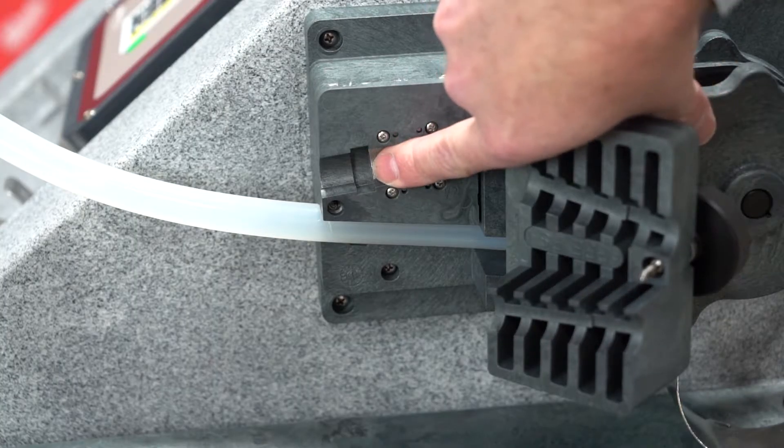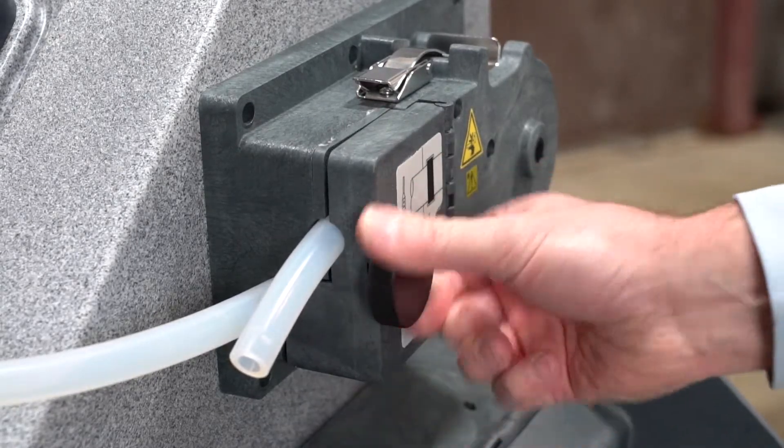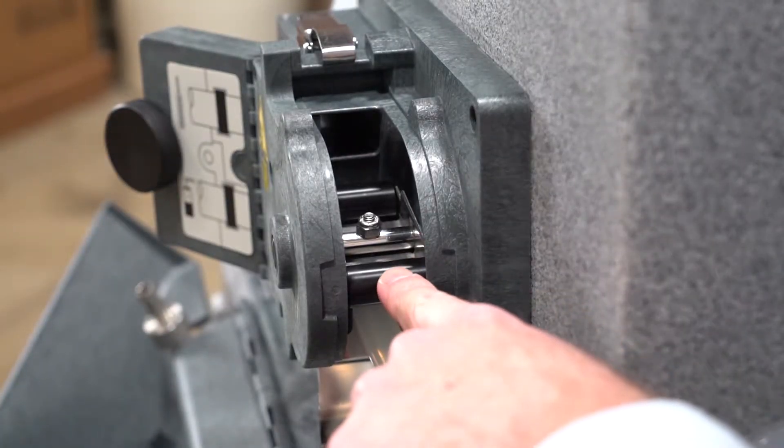Additional components include the alignment collars on the pump tube, the alignment notches in the pump housing, the liquid detector cover with large black knob, the pump housing band, and the pump rotor.